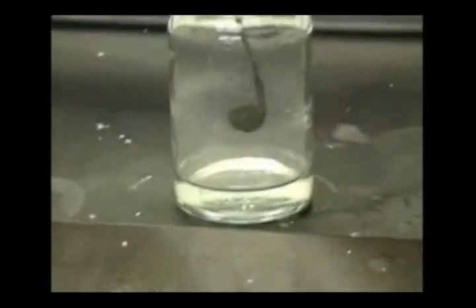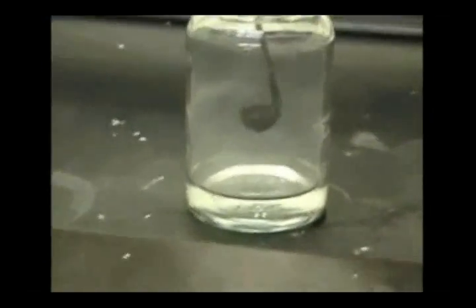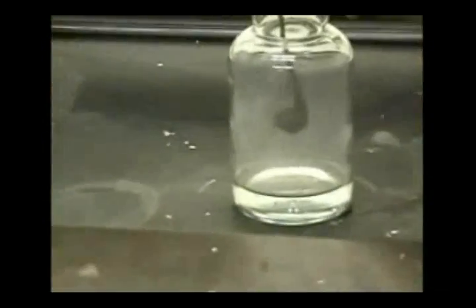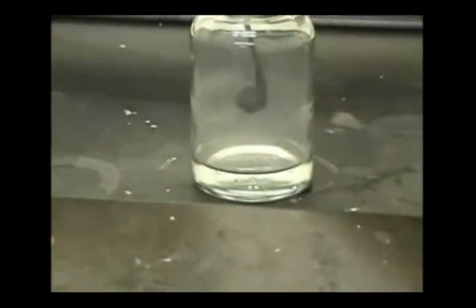As you can see, the glass bottle becomes cloudy. This is because the SO2 gas is being released into the glass bottle.